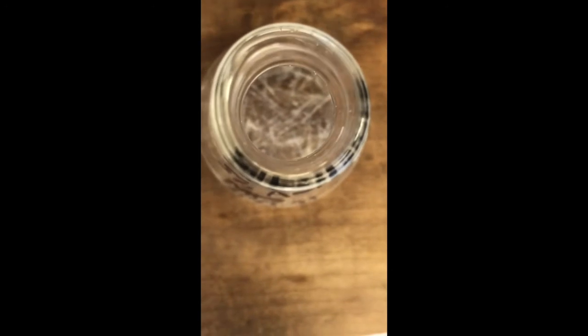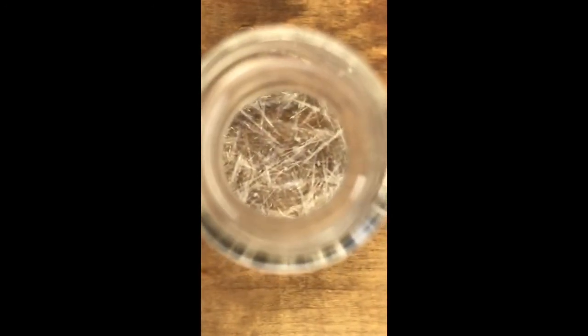Okay, look at that. Pretty nice, huh? That was going for about 25 minutes. I let it cool. I just walked away and let it cool. At this point, we have to make a decision. Do we feel like our yield is enough where we just go ahead and filter this? Or do we think, you know what, that yield's a little low, and I want to agitate it, cool it, do something to have more crystals form, then filter.